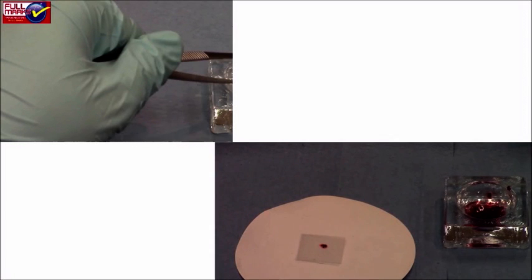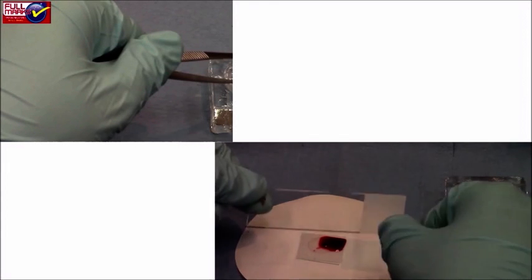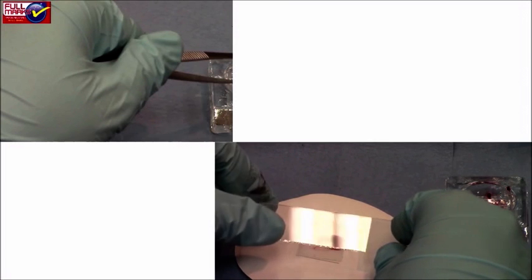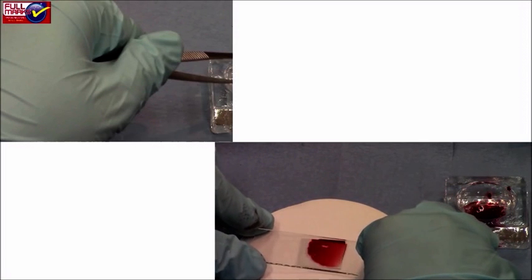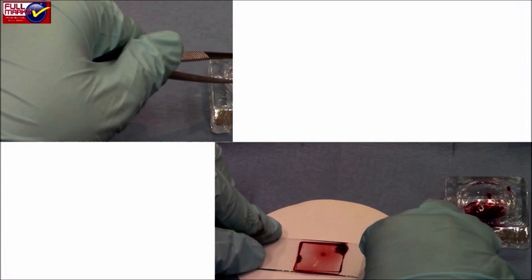The testis are placed on a glass slide. Apply one to two drops of acetocarmine stain. With a sharp blade, the testis lobes are cut into minute pieces and kept for 10 minutes.